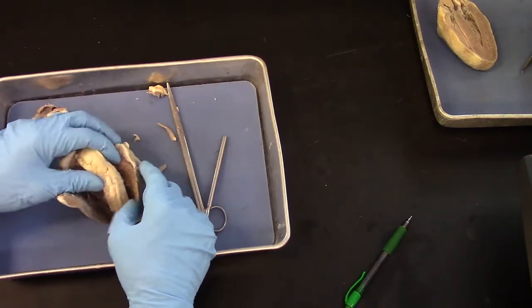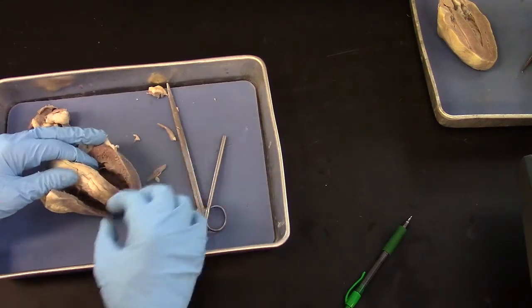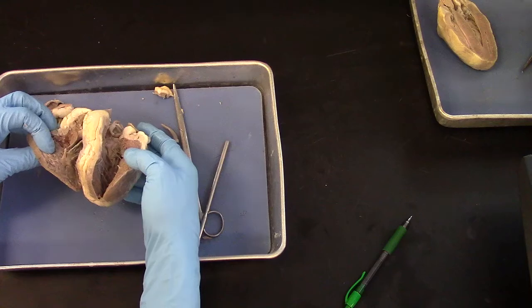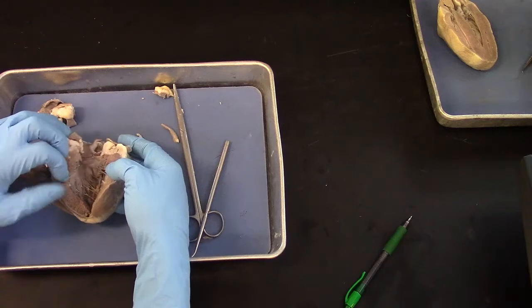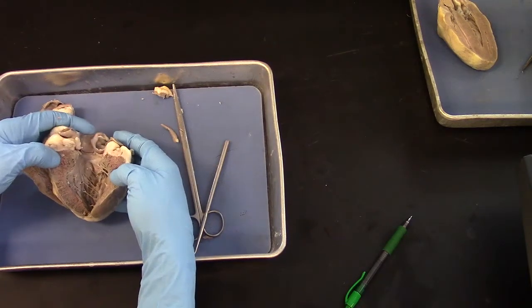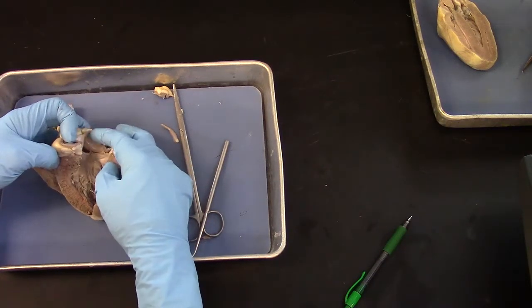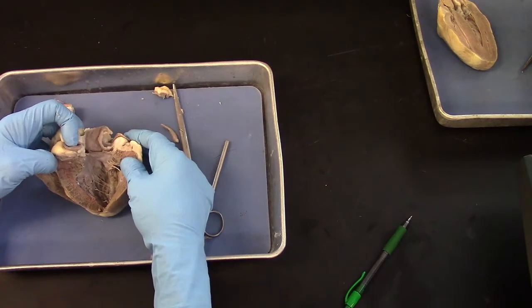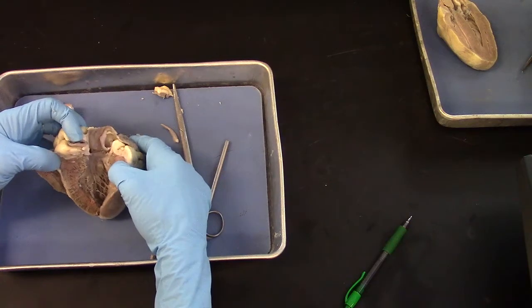So notice that the wall thickness is much greater on the left side than it is on the right side. So if you're seeing a heart and it's opened up like this, you can just look at the wall thickness and realize, oh, right side, low pressure, thinner wall. That means this has to be the left side. And if this is the left side, that means that this valve is the bicuspid, means that this is the aorta, and that would be the aortic semilunar valve. So once you get oriented, you can go through by process of elimination to identify the proper chamber, valve, and vessel. So that worked out fairly well.